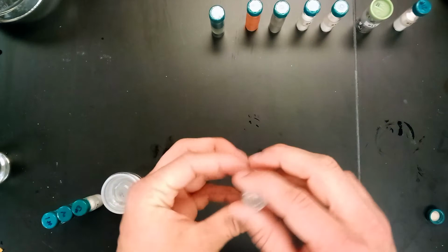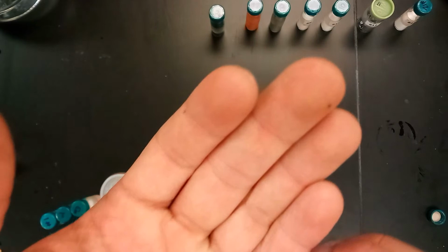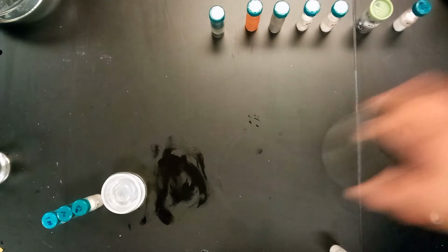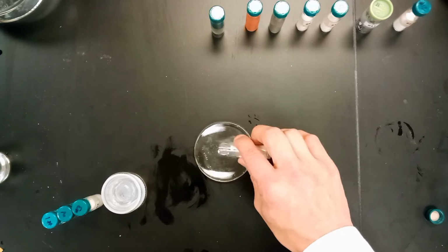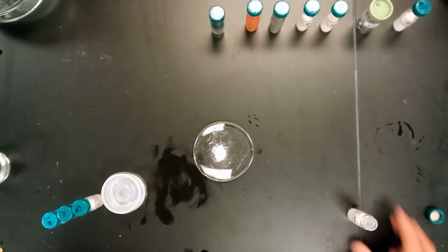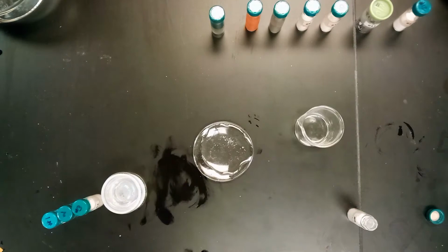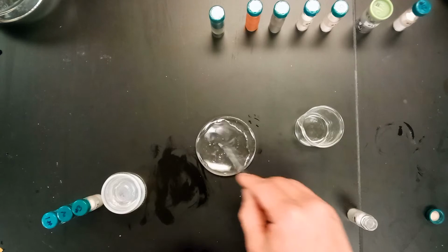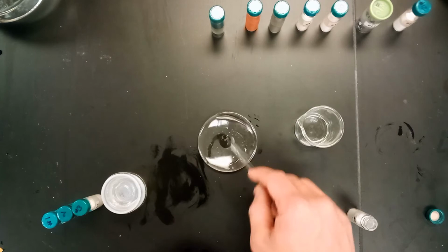Got number 5 here now. Hard to describe. It's just sort of a white powdery thing, just like other ones we've seen before. One of the big clues that we can get from it is whether or not it's soluble in water. So we'll take some distilled water here and add it to our tray. Pretty immediately on this one, you can see that it is soluble in water. Not all of it's dissolved yet, but a good chunk of it sure has.